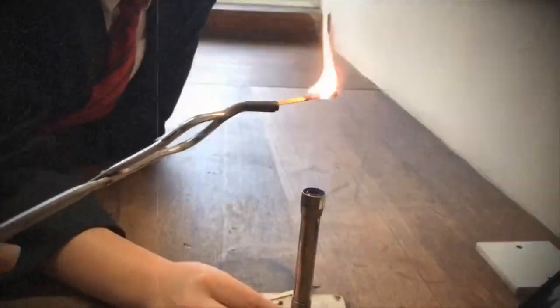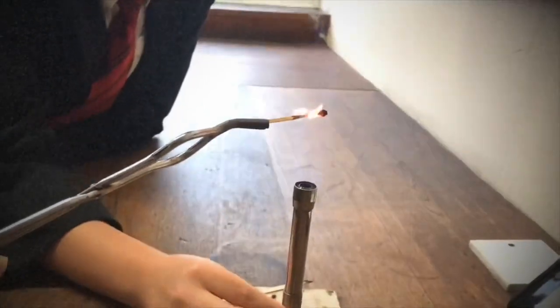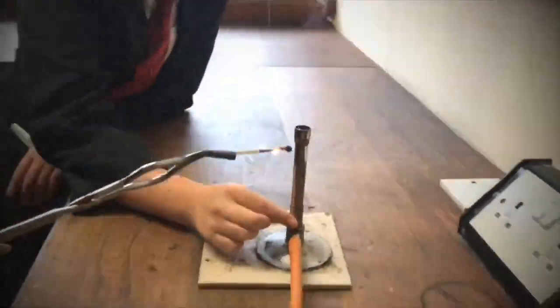We call this process roasting, where unreactive metals can be extracted from a compound just by heating them up.